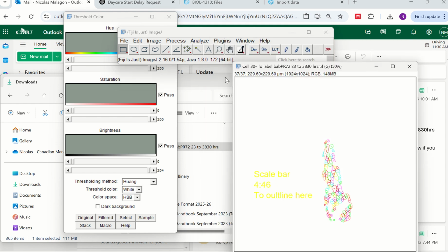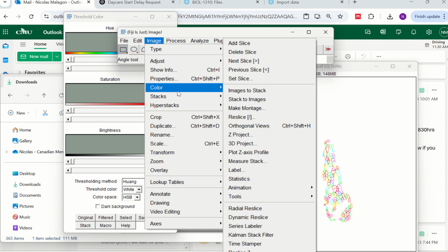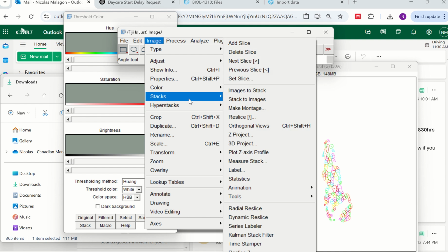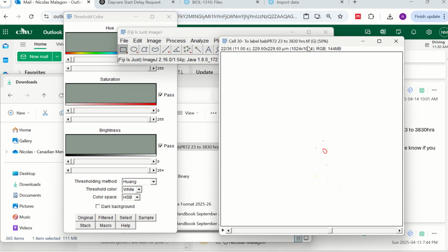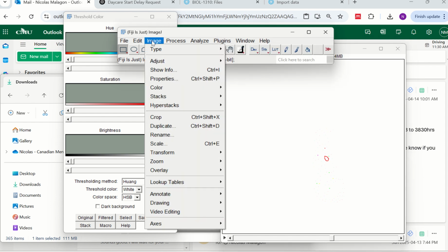I will go fast because I know you have done it before. So here we don't need the last slice. So we go to Stack, sorry, delete the slice. Why? Because we don't need the outlines that we had before to label the cells in this case. So now we have mainly red and some colors. So now the next step that we can do is the same. Now follow the same steps that we have been using.